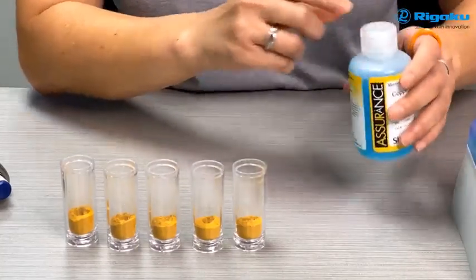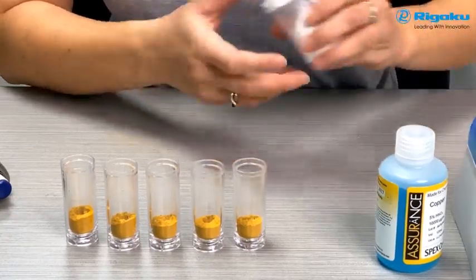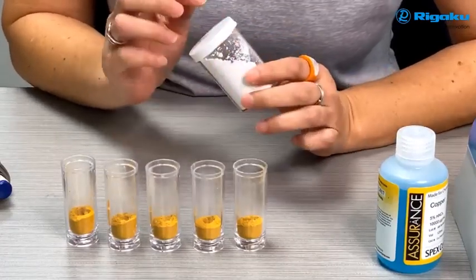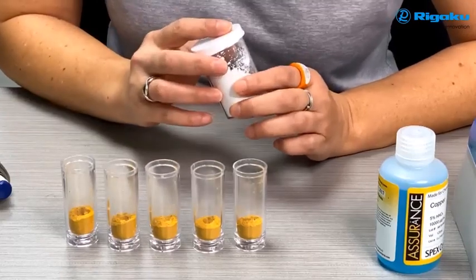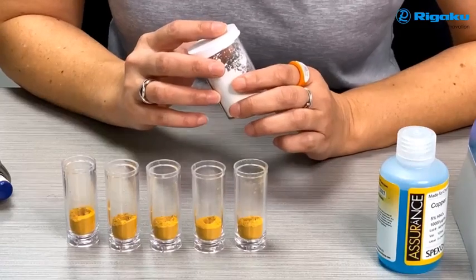Exactly. What if that acid in there will react with your base materials? Is there something we can do to get around that? Oh, that's a great question. What you can do is get some kind of binder, cellulose in this case, spike it into that, dry it, and then from there you can take that spiked binder and add it into your material. Okay, so you're already getting rid of the acid. When you dry it down, you don't have to worry about that. All right, and most people use binder anyways in their pellets. Exactly. All right, perfect.